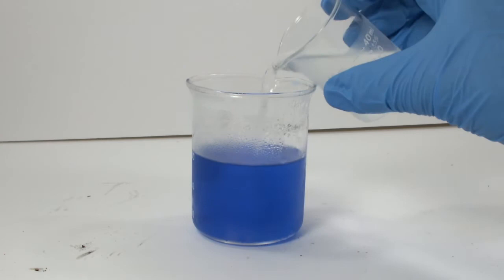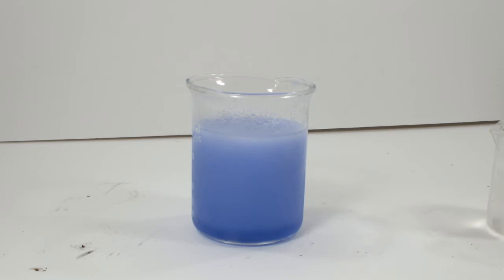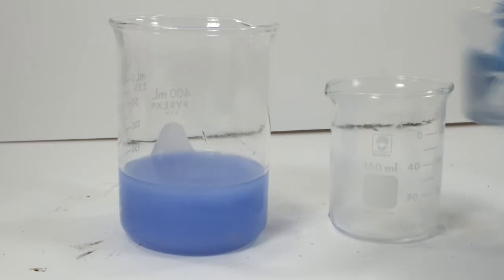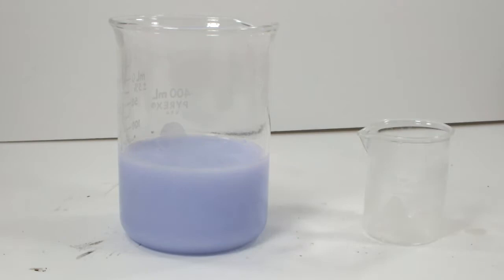Apparently that's going to take a little bit more acetone. By adding the acetone, we're changing the polarity of the liquid phase. The complex is fairly soluble in water, but as acetone is added and the overall polarity decreases, the complex is less and less soluble.